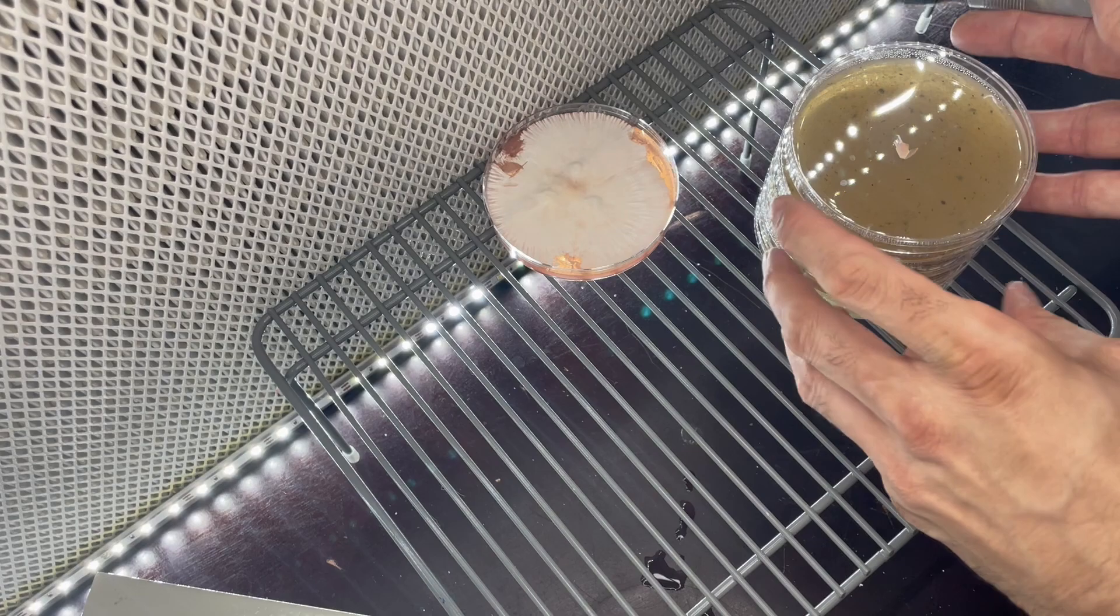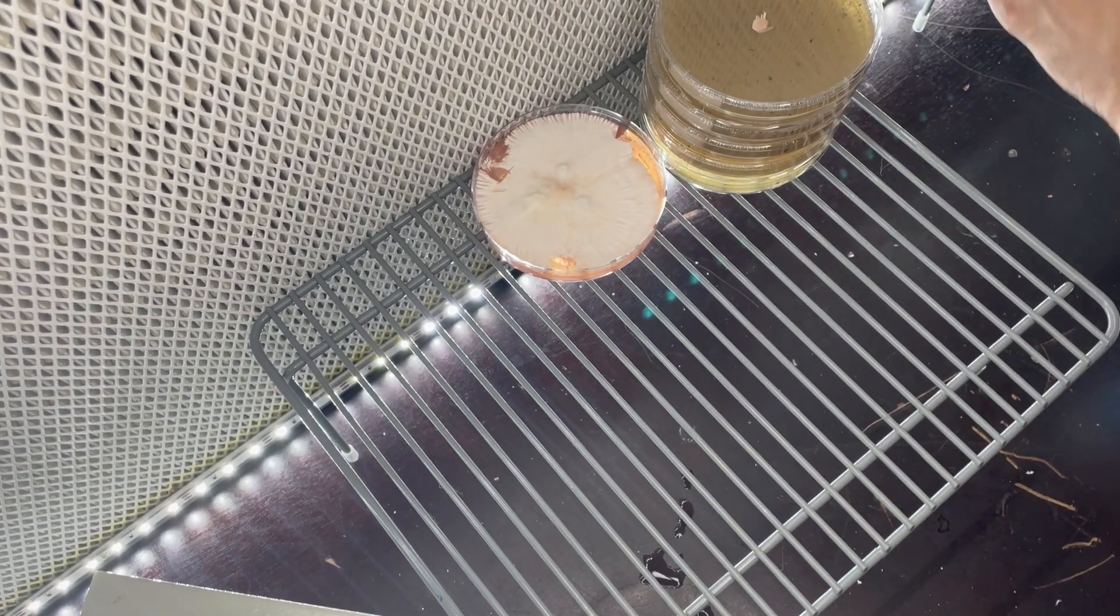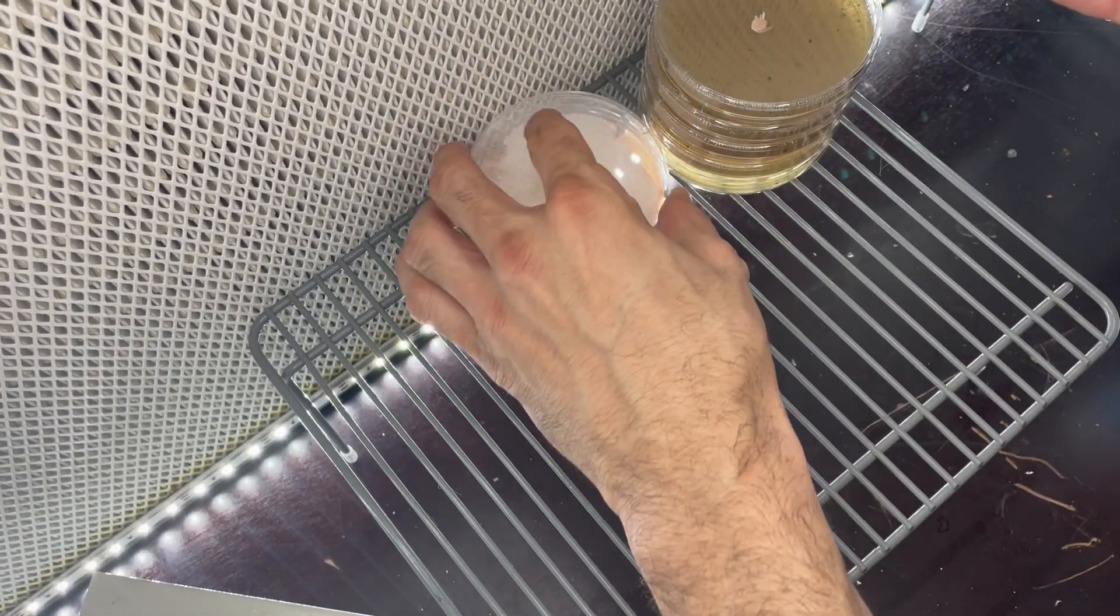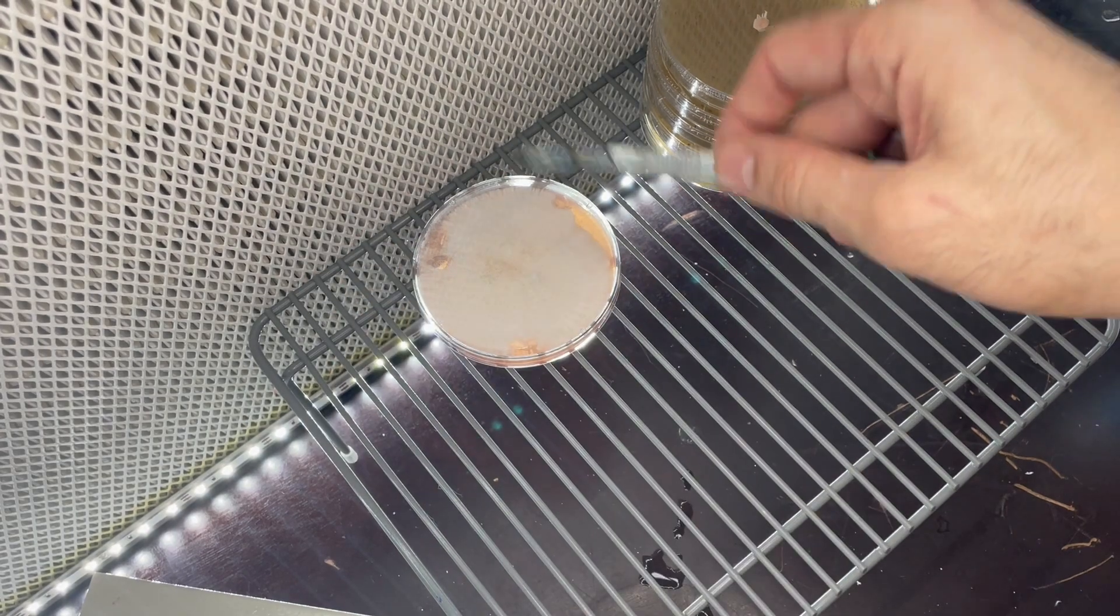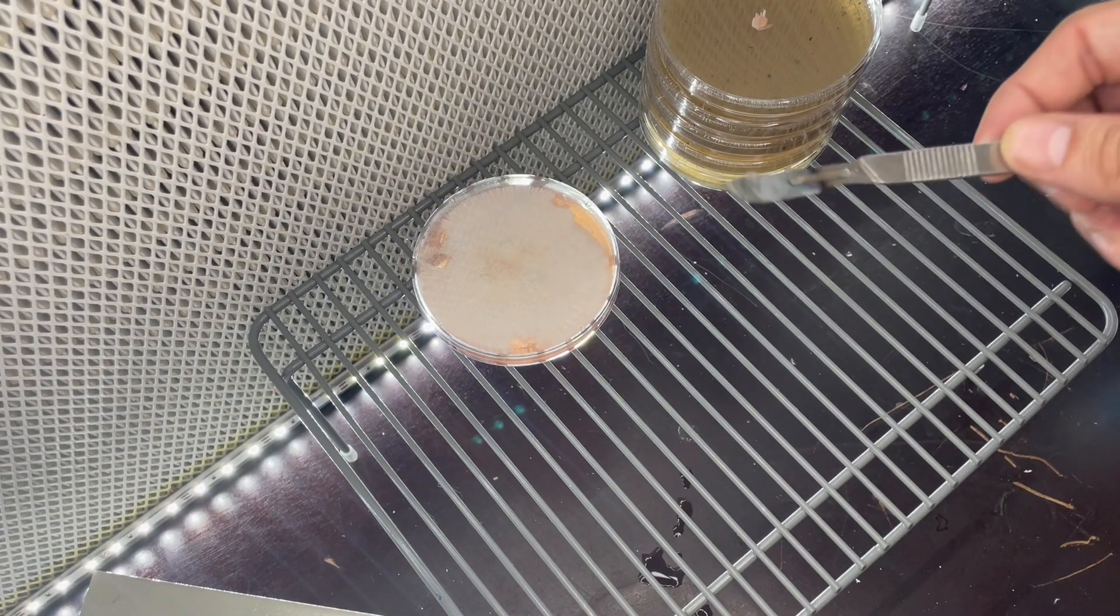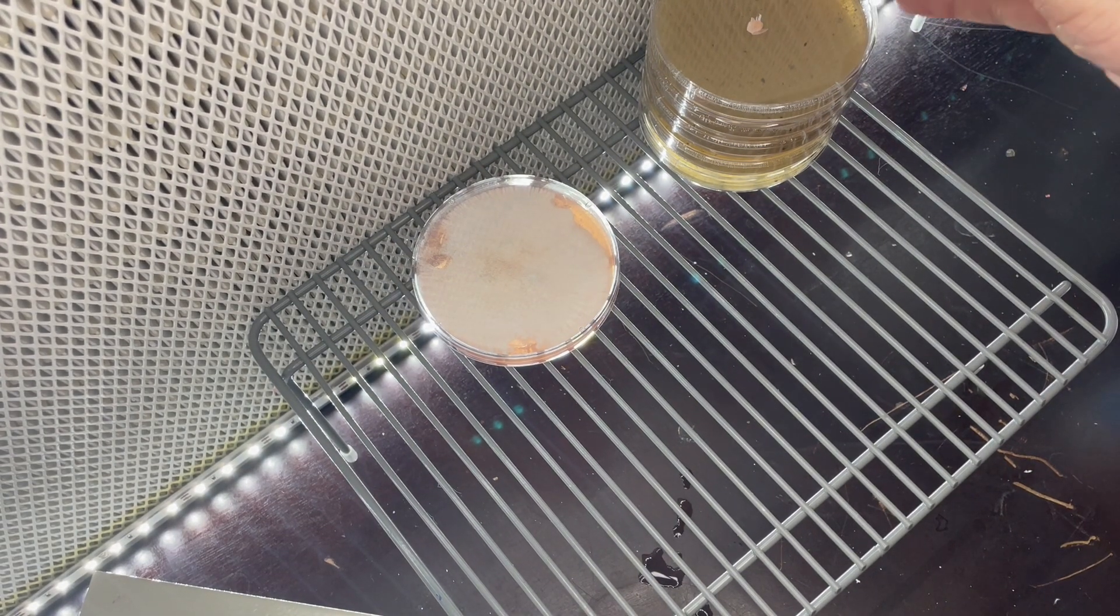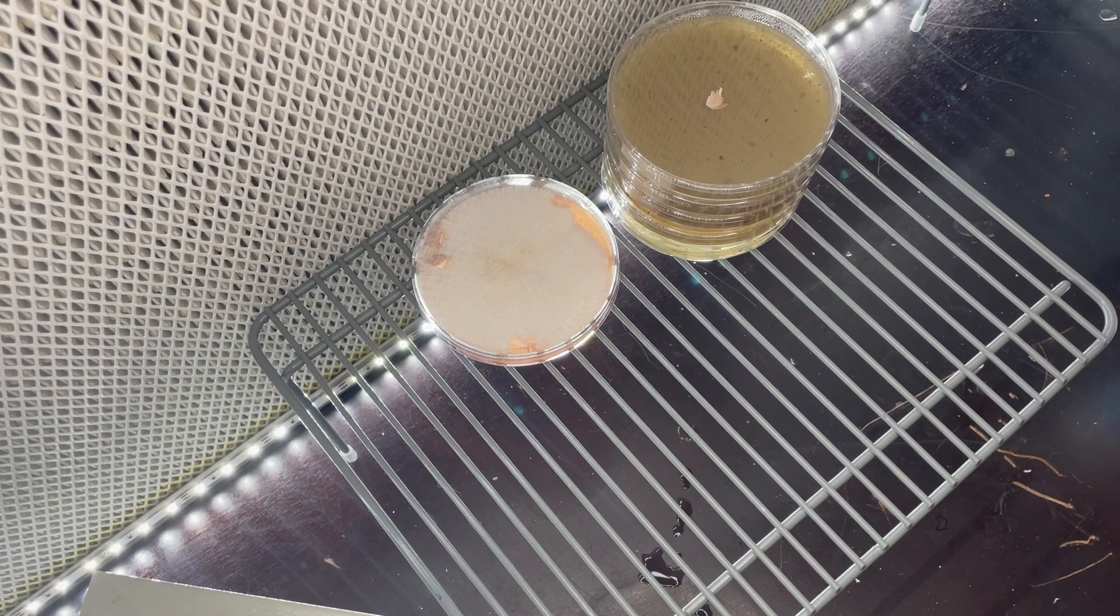And from here, I'll wrap these plates back up and you're good to go. You've just done a transfer from one agar plate to a second agar plate. In about a few days these will grow out and you can work from there.